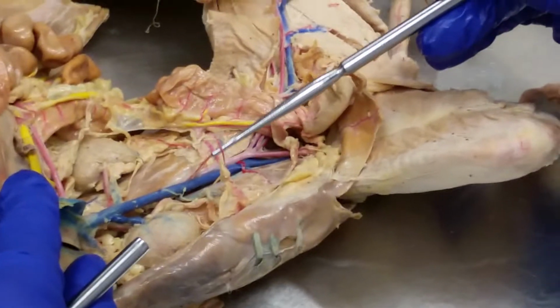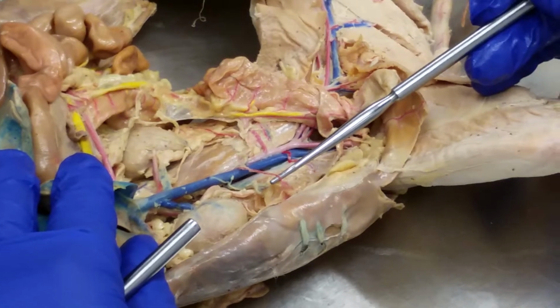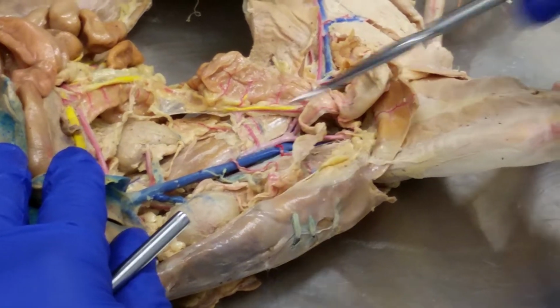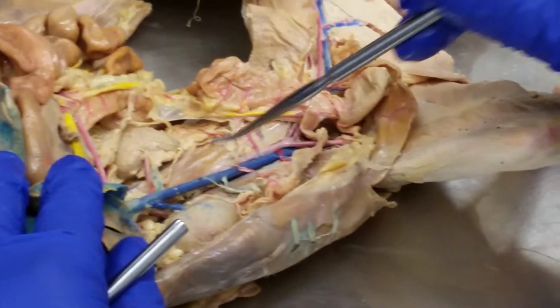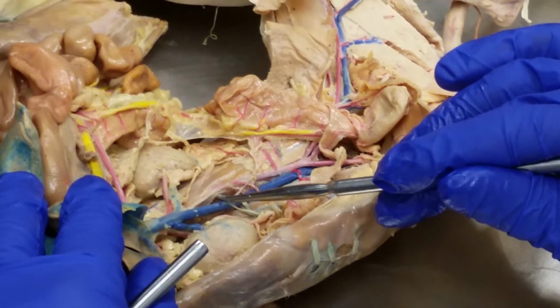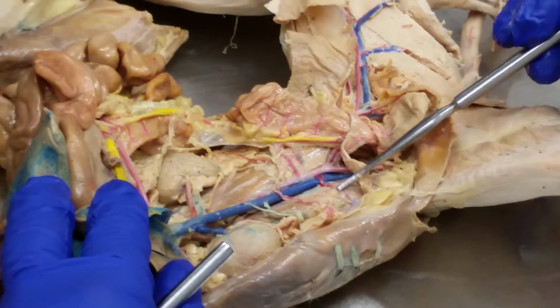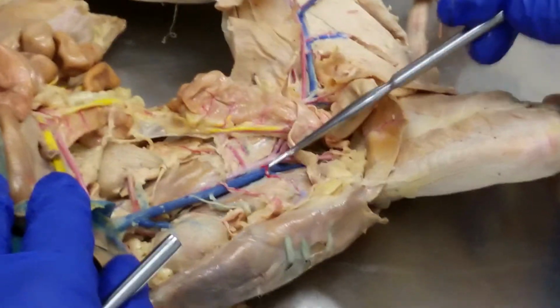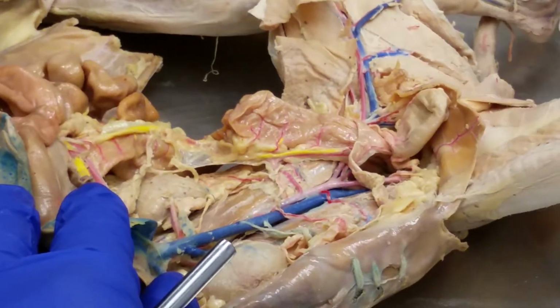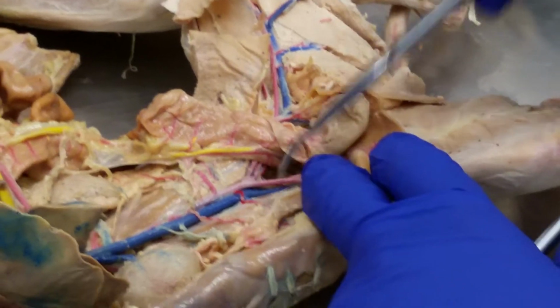And this would be the internal ovarian artery, because it's a female. All right, and then this would be the abdominal aorta, okay, and this would be the iliolumbar artery and vein. These two guys, see that one and that one, iliolumbar artery and vein, and it's also on this side, iliolumbar artery and vein. Okay, then we come down here.